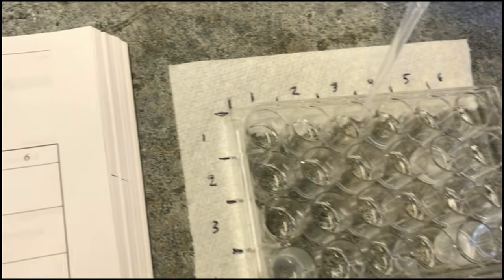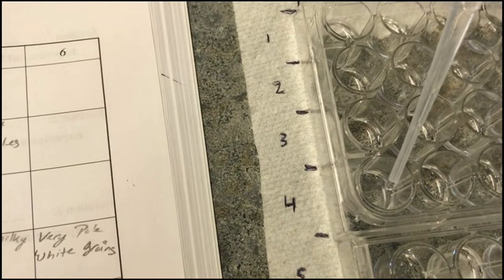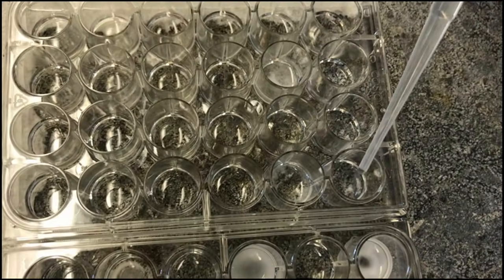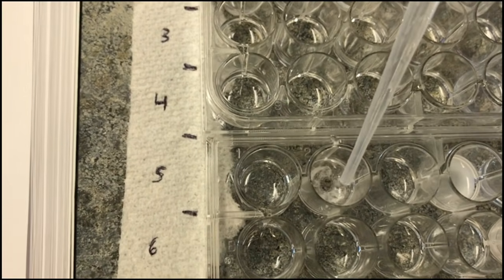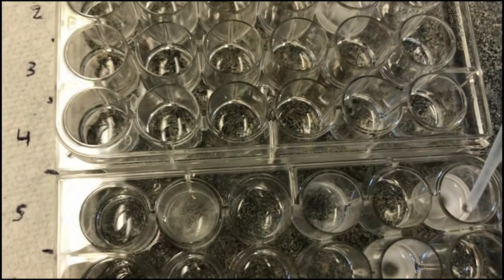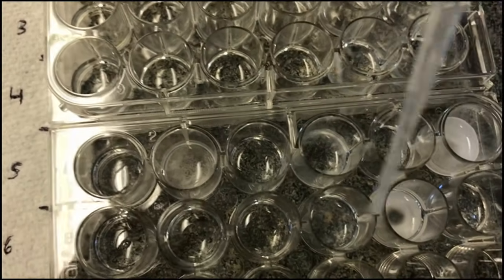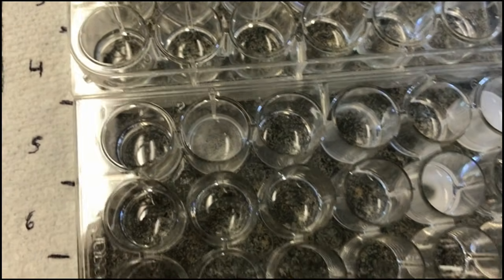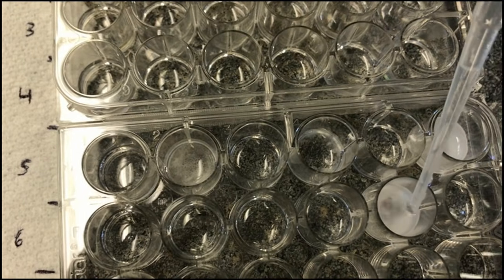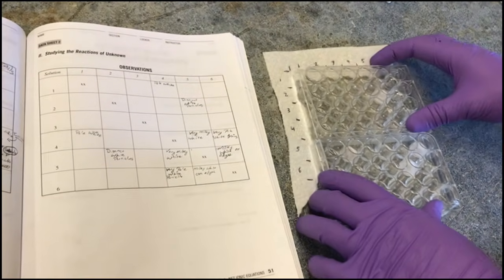Thanks for letting me edge you out. I just thought it was better to not be standing right in your grill while you were working. Yeah, that's fine. Oh, all right, I'll pull back. See if I can get in here and see what goes on. That's all of them. So we're going to let it sit, swirl, and then we'll see and record any observations that happen.